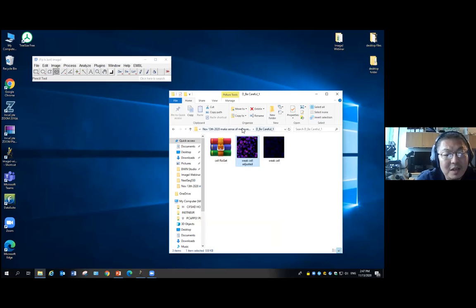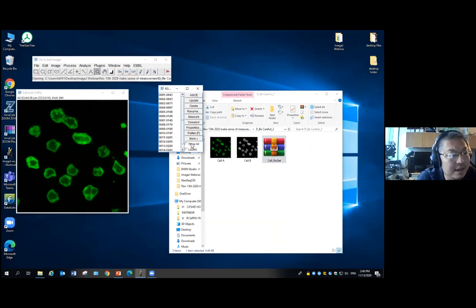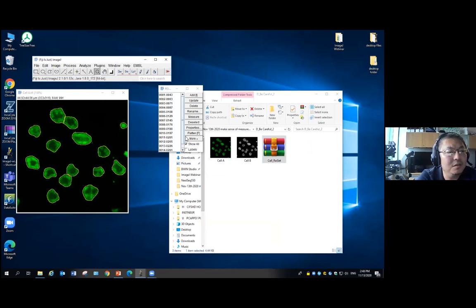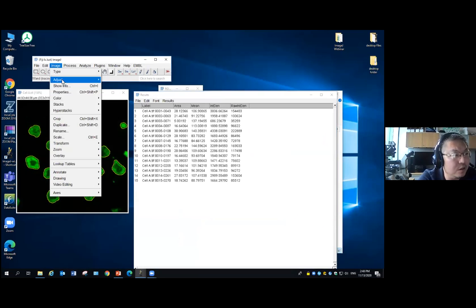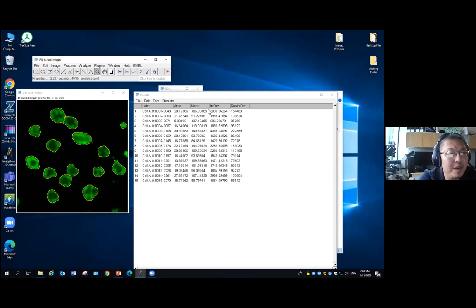Another thing that sometimes happens is the image bit depth. So here I have two samples. This is cell A. I open it, and this is my cell. I want to measure the size, mean intensity, and the total intensity. I measure it, and we have a total of 15 cells. For each cell we have the size, which we can quickly check in the properties, in square microns. This is the mean intensity of each pixel, and that's the total intensity here.